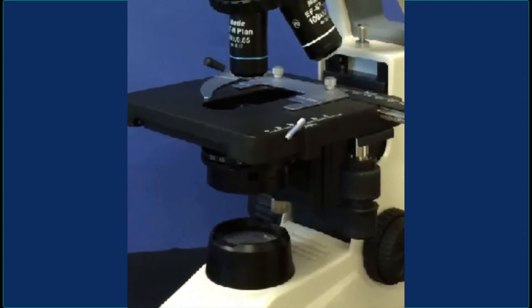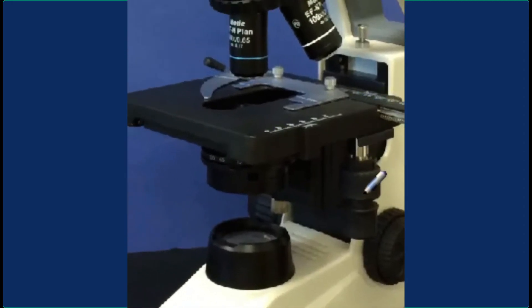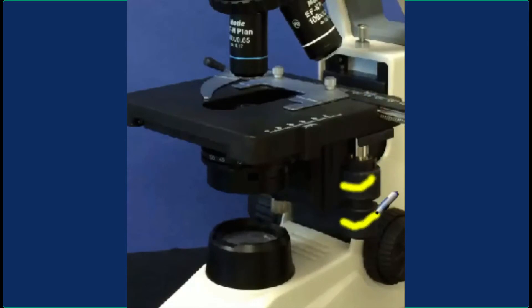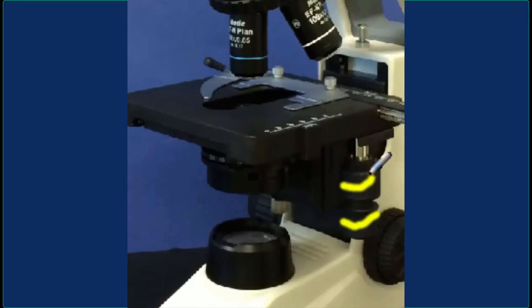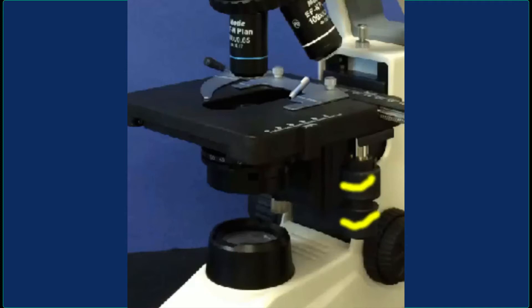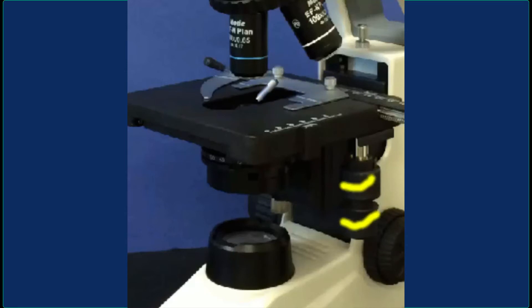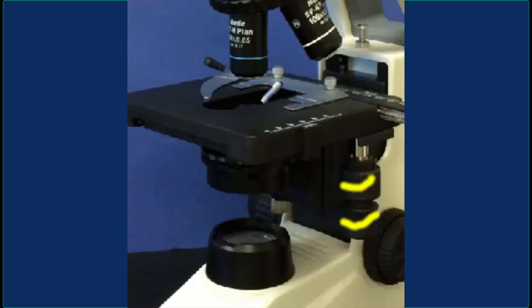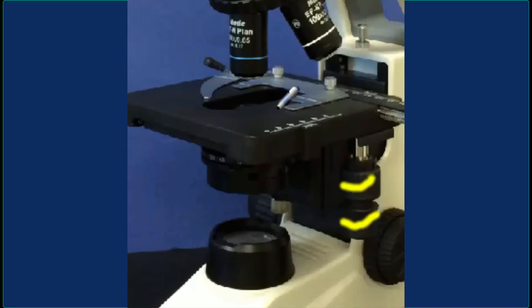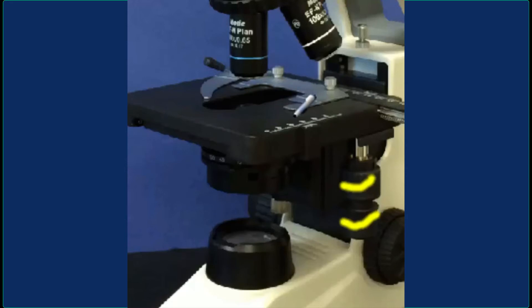Underneath the mechanical stage, you have two knurled knobs. By moving each of these, you can move the clip that holds the slide in either the X or the Y direction, and therefore you're able to move the slide essentially in any position in a two-dimensional plane.